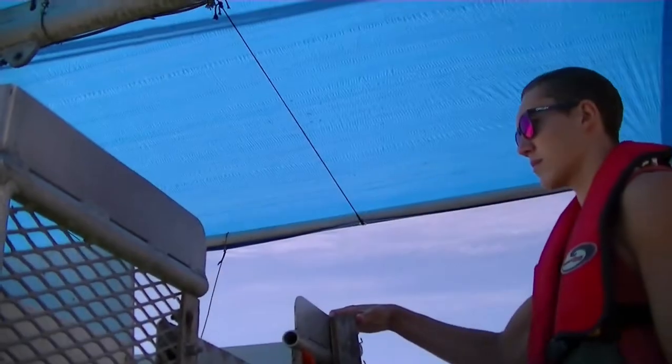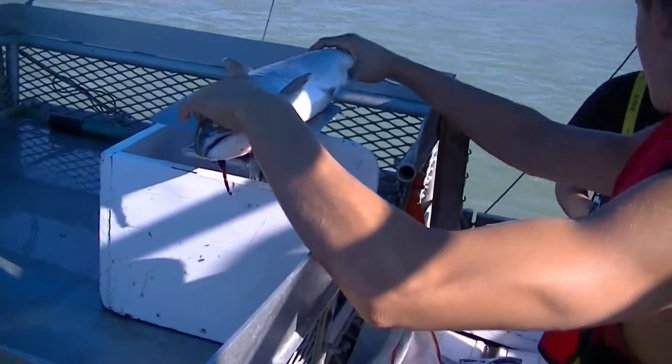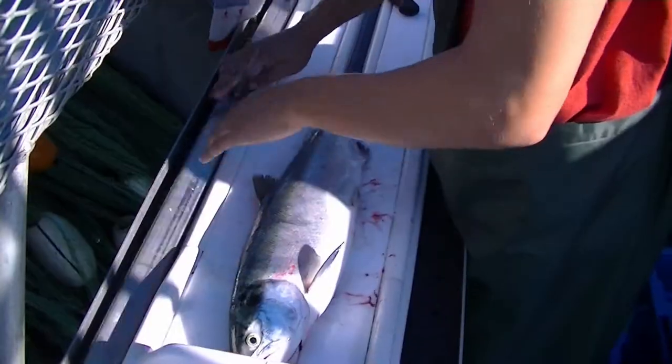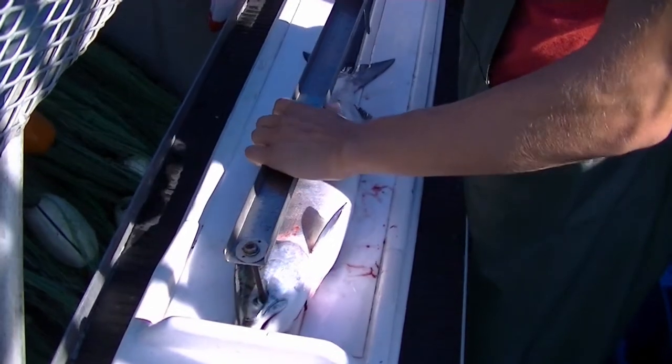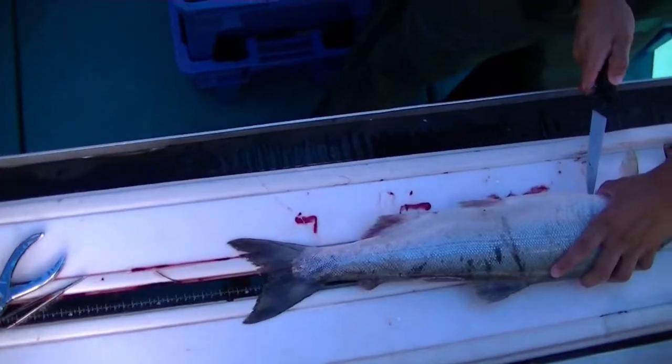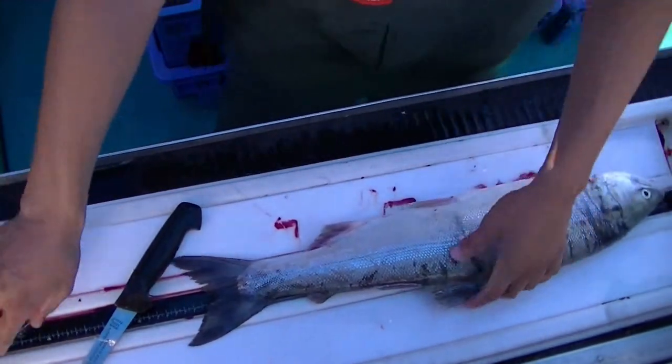Let's start with an overview of the sampling process for a single salmon. This sampler starts by weighing the fish on a scale and reading the weight to a recorder. The sampler then places the fish on a table and reads the length between the two stakes of the measuring stick. Next, a small slit is made along the ventral side of the fish and the sampler feels the gonads to determine the sex.